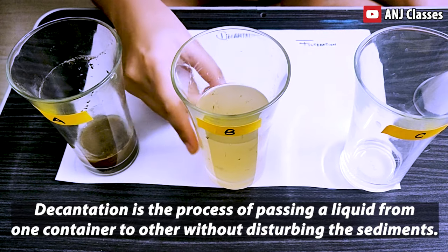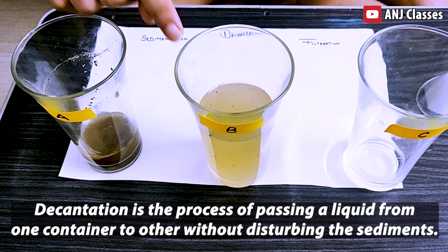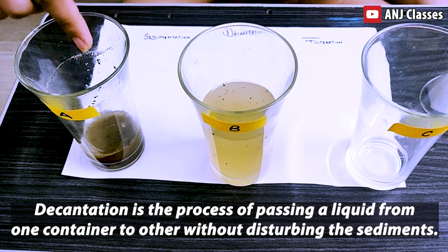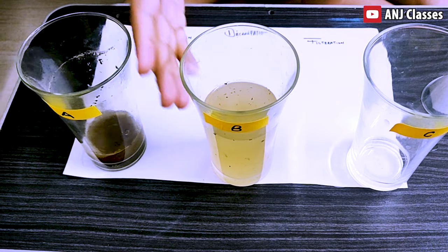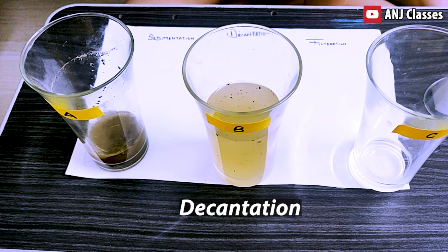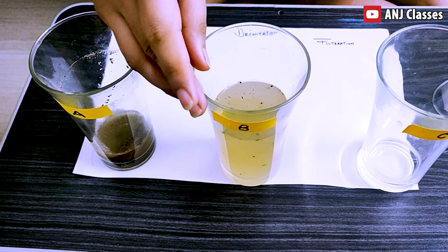Now you can see — the removal of water above the sediment, this process is called decantation.